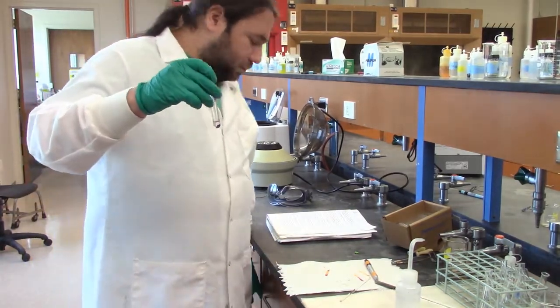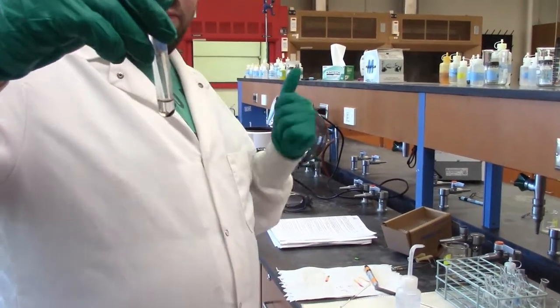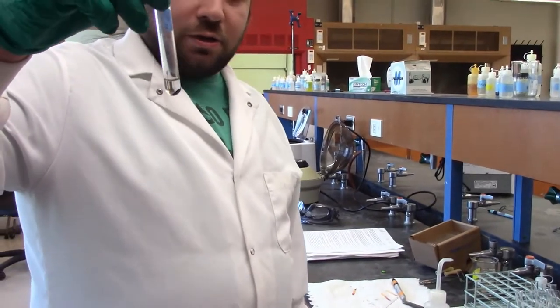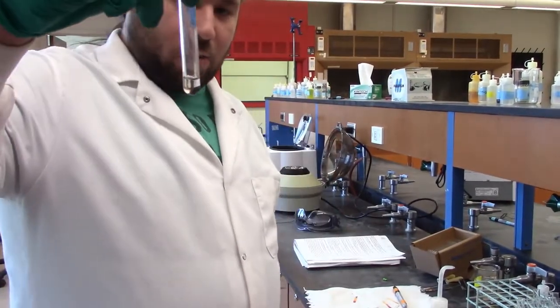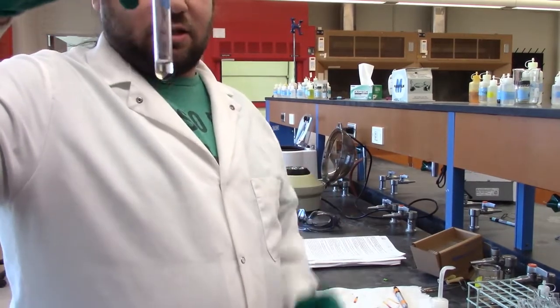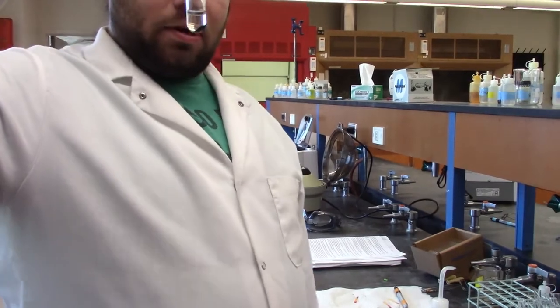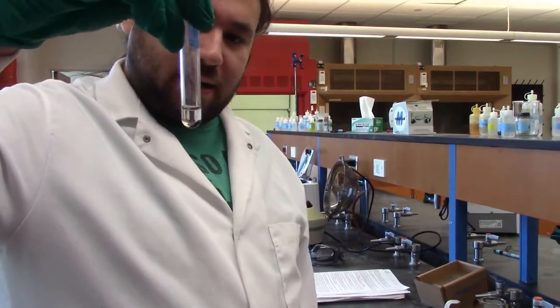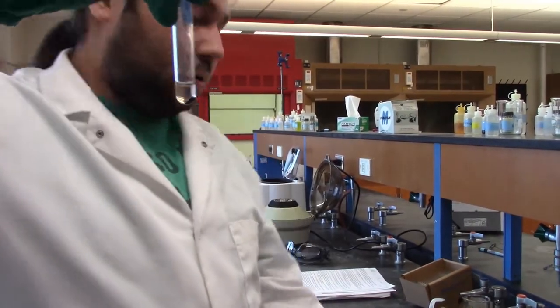Alright, so here's our supernatant. Here's our stuff from before. We acidified it, we put it in the hot bath, and we centrifuged it. We forgot to put water in there, so we did add water. So it wasn't just the acid, it was acid and some water. But as we said earlier, now we've made a complex ion with the cadmium. So we should have cadmium in our supernatant, and our precipitate here should just be our other two, the bismuth and the copper.